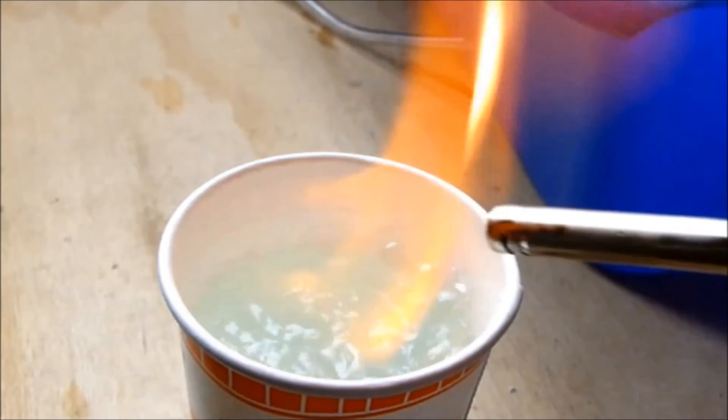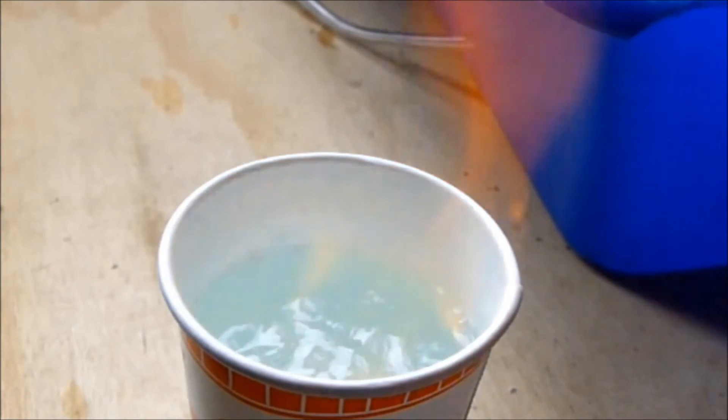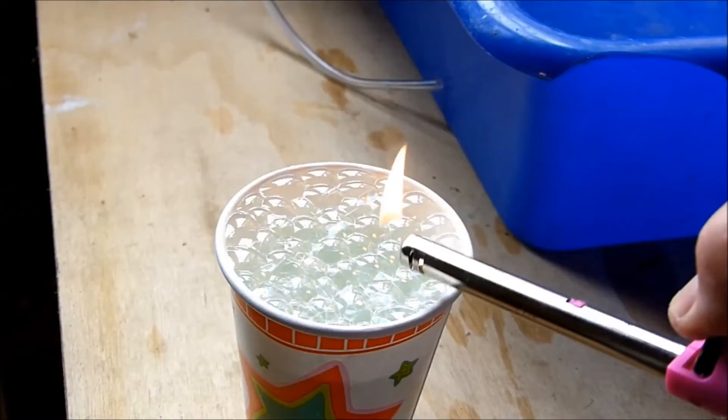So these bubbles are hydrogen rather than the hydrogen oxygen mix that you'd get from electrolysis. And that's the reason it's burning rather than exploding.